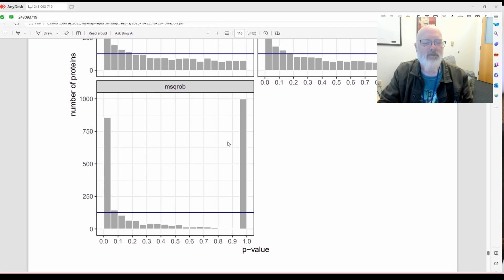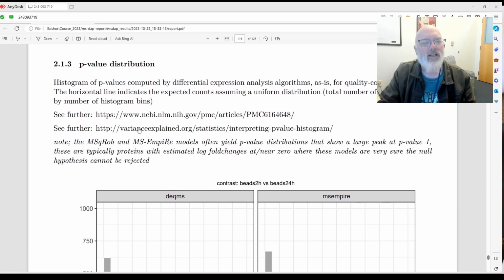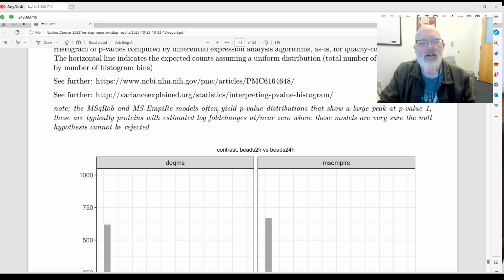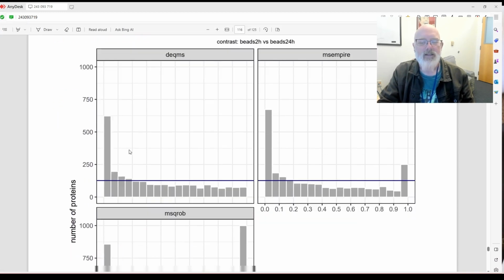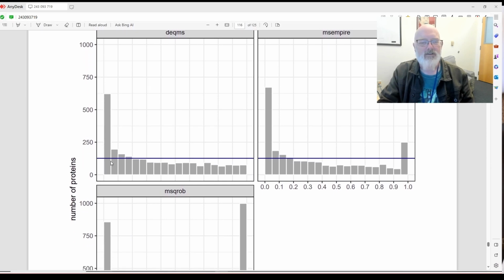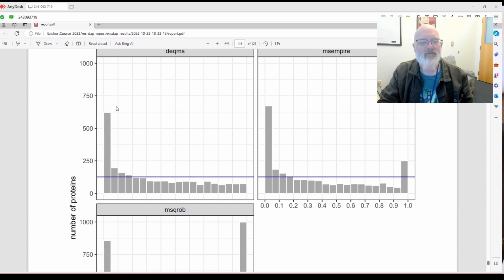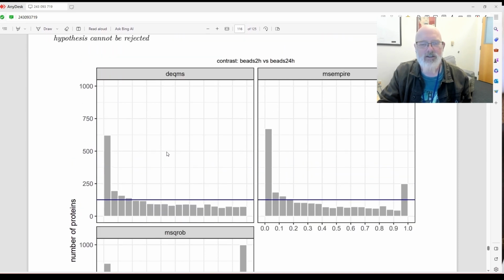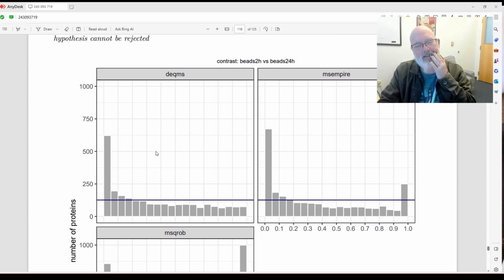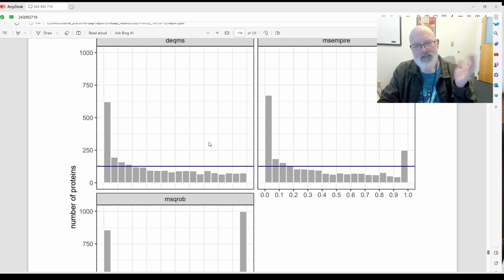What I like is to look for a big stick at the beginning, and then it should tail off like this. And it does give you a little warning here that MSqRob and MS-EmpiRe often yield p-value distributions that show a large peak at 1, which is here. So I like to see a big stick at 0 and then smaller and smaller as it goes this way. And remember, if your p-values are U-shaped or look weird, then the Q value or the FDR correction isn't going to work correctly. If you look at the manual for Benjamini-Hochberg in R, it gives a good example of how the FDR correction isn't going to work if you see U-shaped p-value distributions.